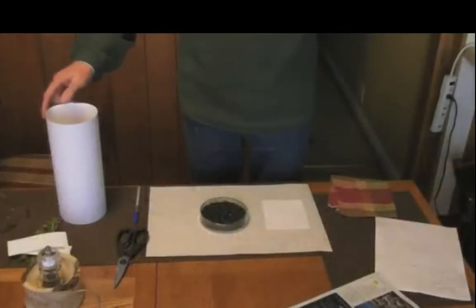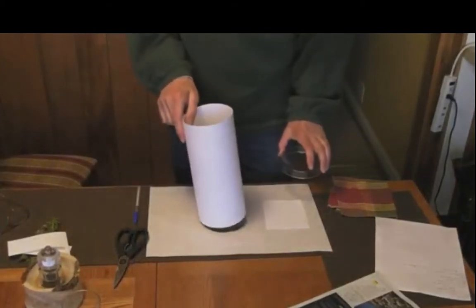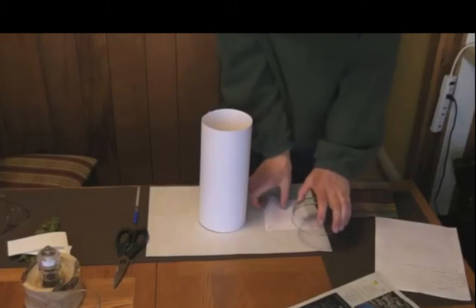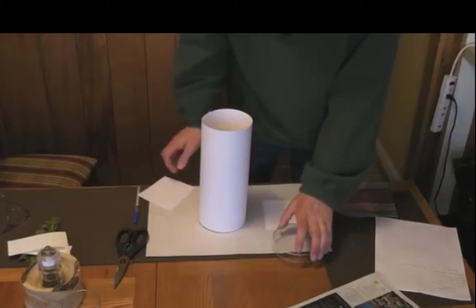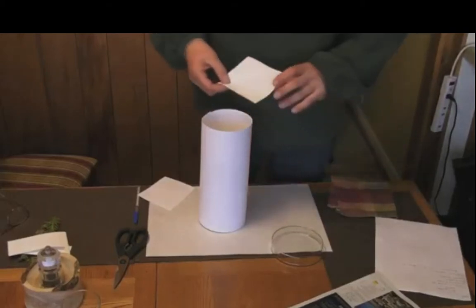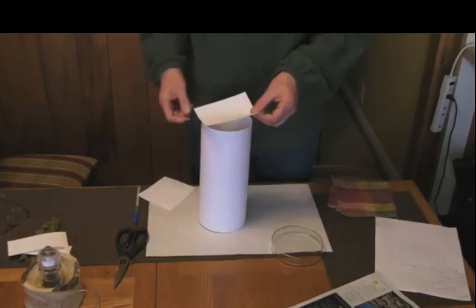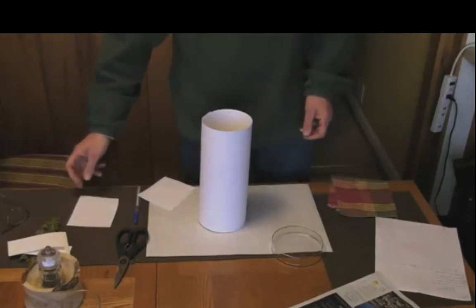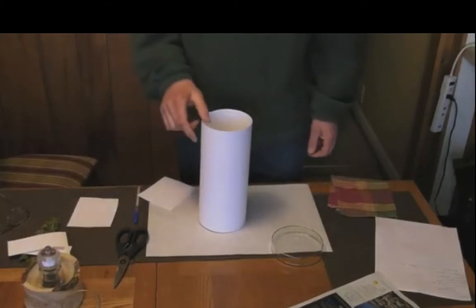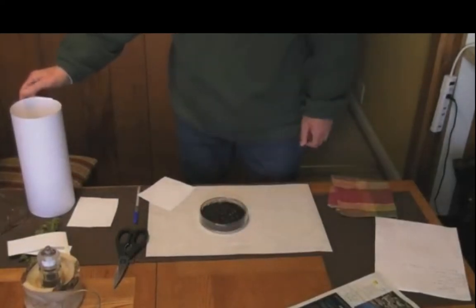Now that everything's ready, it's time to sow the spores. And as luck would have it, sowing the spores is one of the easiest parts of the whole process. I make a paper tube that fits just around the Petri dish, and I set it there to guide the spores down to the medium below. Then I bring the paper to the top of the tube, turn it upside down, and tap firmly on the back to release the spores. I wait a few seconds for them to float down to the Petri dish, and then I put the lid on, and the spores are sown.